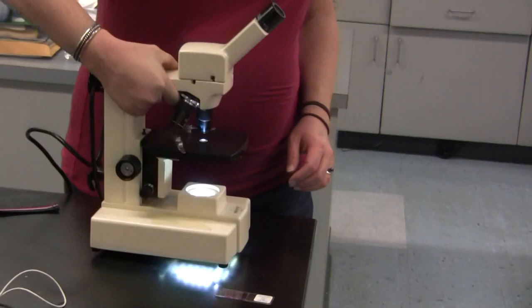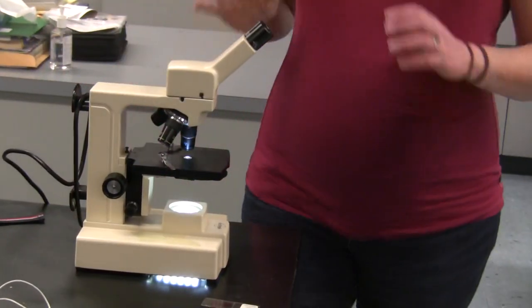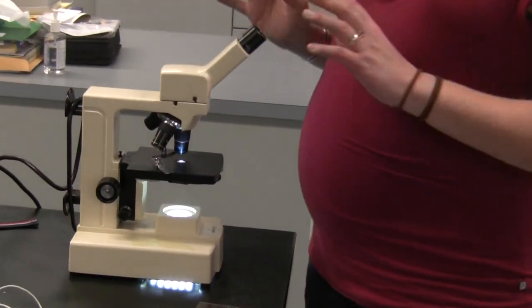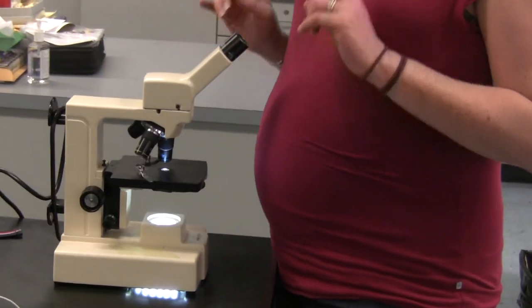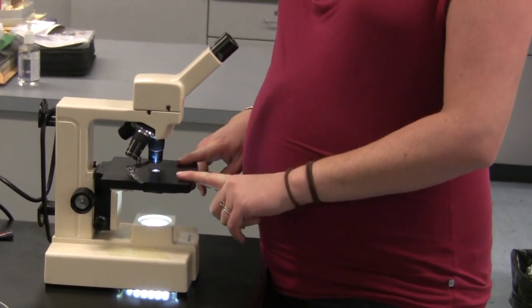So once the light is on, there are several pieces you need to do before you even start the slide. First, you need to lower the stage.